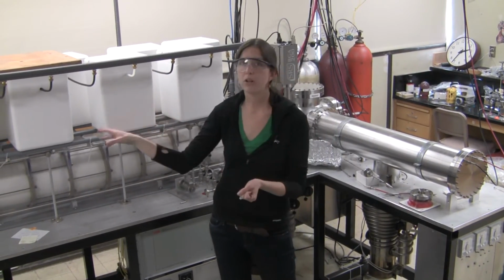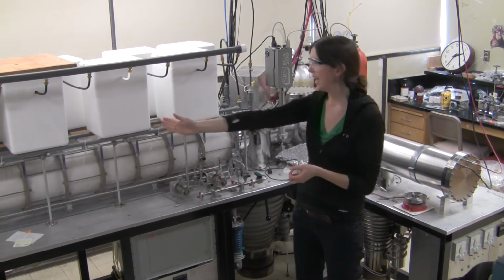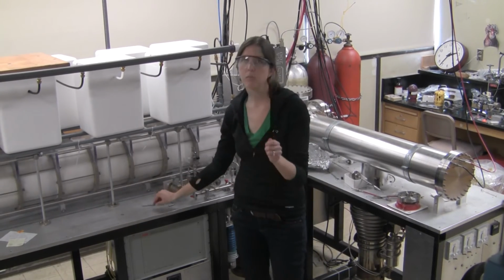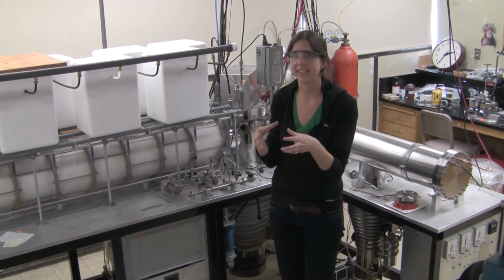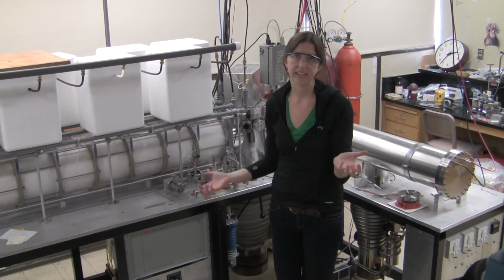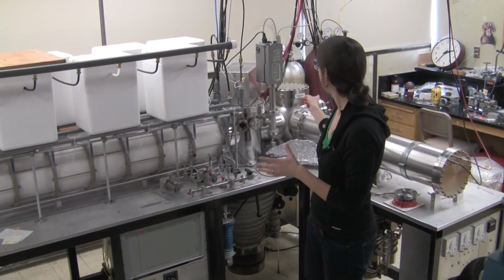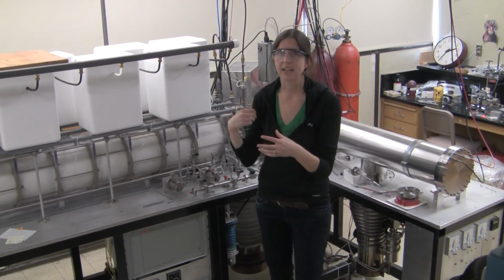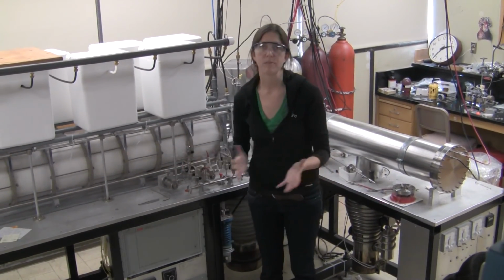To do this, we pulse the ions in all at the same time into the beginning of the drift tube, and they pass through under the influence of a weak electric field. Smaller, more compact ions in our sample mixture encounter fewer collisions with the helium gas, whereas larger, more extended ions encounter more collisions with the helium gas. And so we can actually separate these by their sizes as a function of how soon they arrive at the detector. Those smaller, faster moving ions reach the detector sooner than the larger, more extended ions. And this is how we can do our ion mobility experiment.